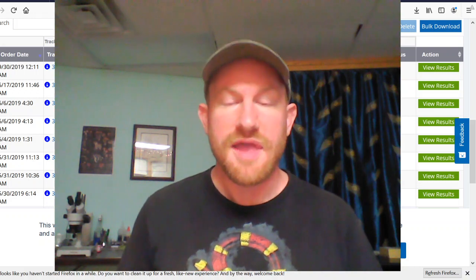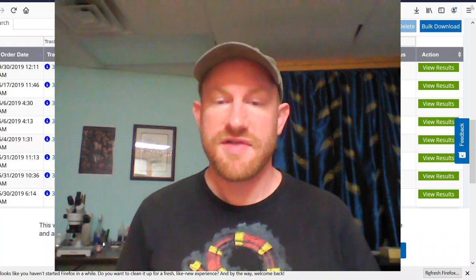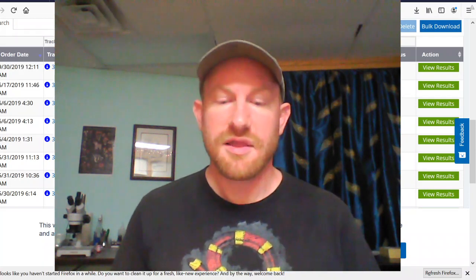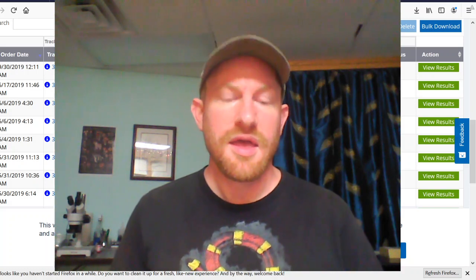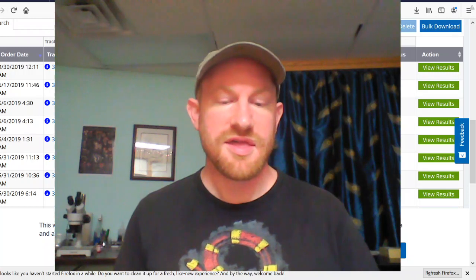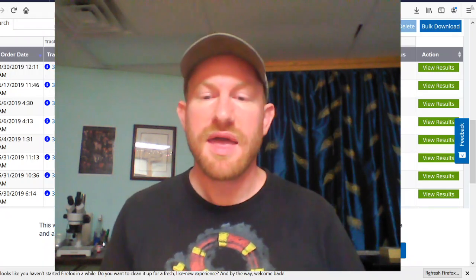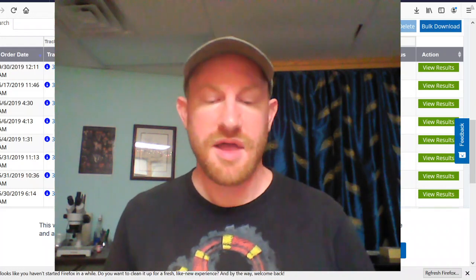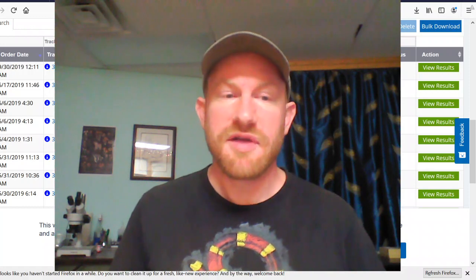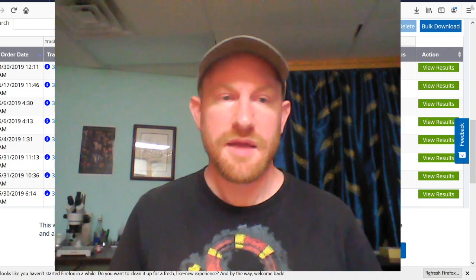First we're going to download the traces from GeneWiz or whatever sequencing facility you use. And then we're going to use SnapGene to load in the trace file and see if there's any errors in there. We'll verify that the trace is good using BLAST. And then we will submit that to GenBank so the data is available for everybody else forever. And then we can look into how to generate phylogenetic trees to turn your sequences into useful data.